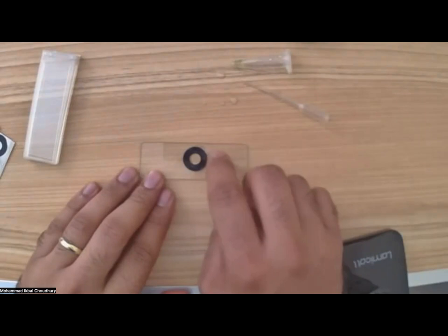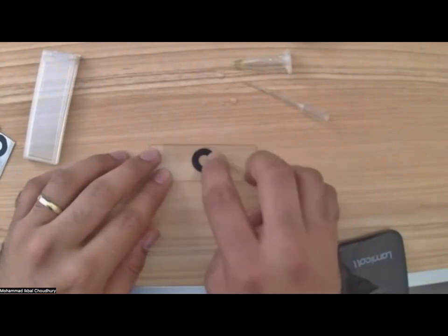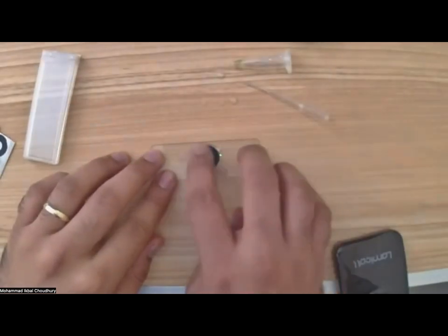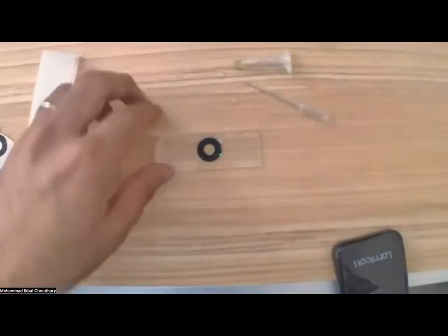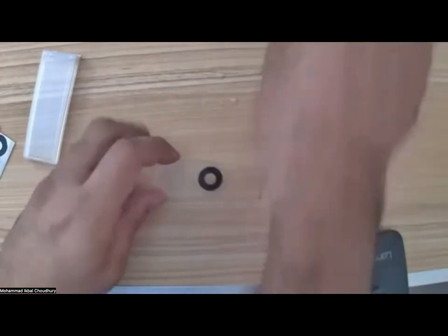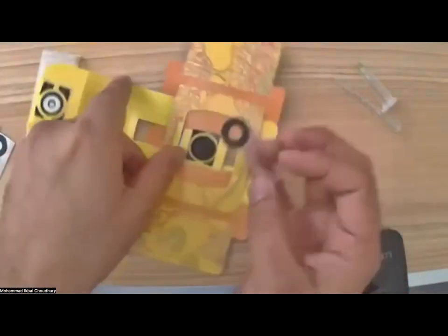So I had an overflow, but I can still see some green particles, and we'll all be able to visualize it soon. So just tapping, and if you have excess water, maybe you can use a paper napkin to get rid of it, but it's okay. This device is quite robust and it's not going to get damaged because of that water. Okay, so now that I have the sample ready, and I know that's the side of the sample, there is no ambiguity here. So what I will do is I will place it back into my foldscope.